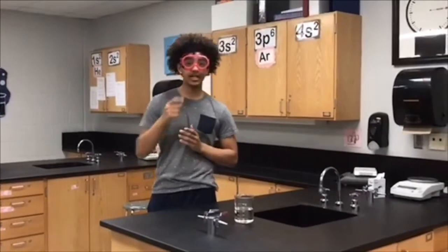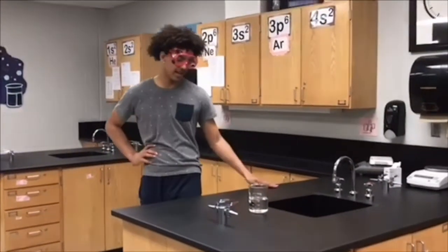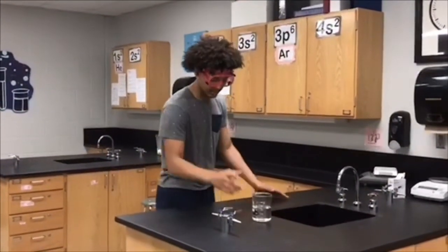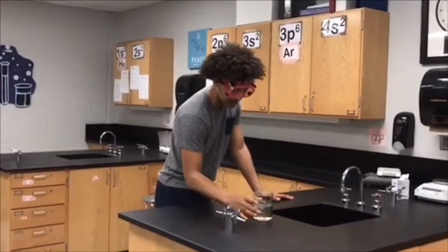Okay, this is how you properly waft. All right, guys, now after that, that's a bad example. Now this is a good example. You go up to the milliliter line.